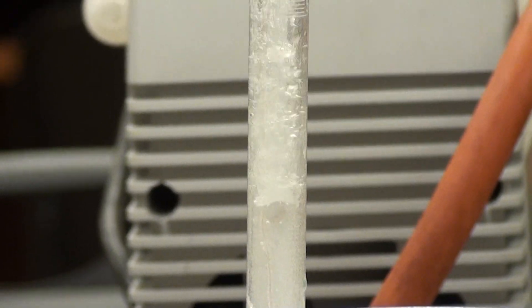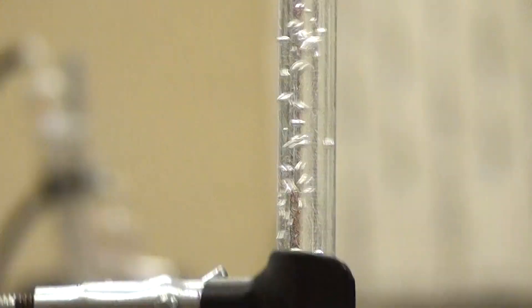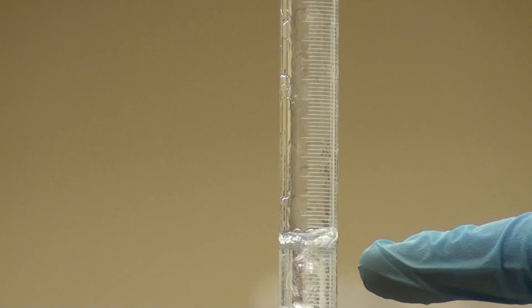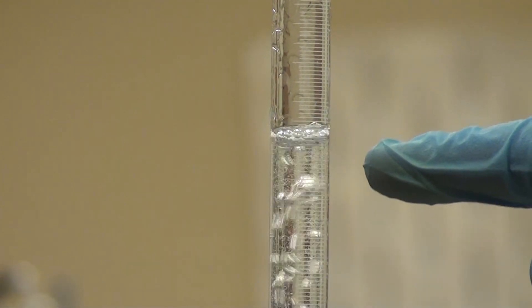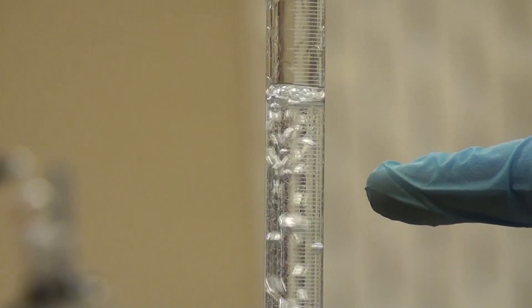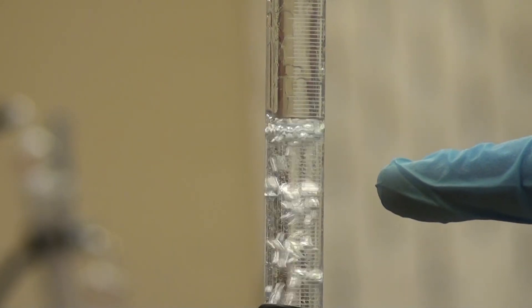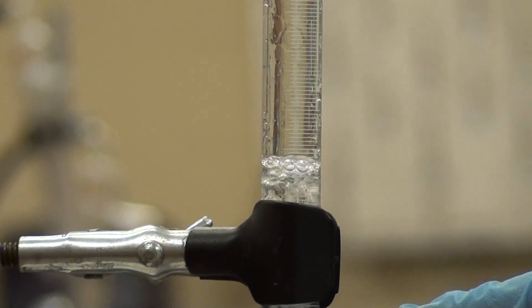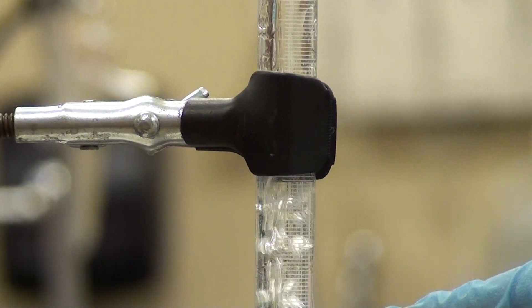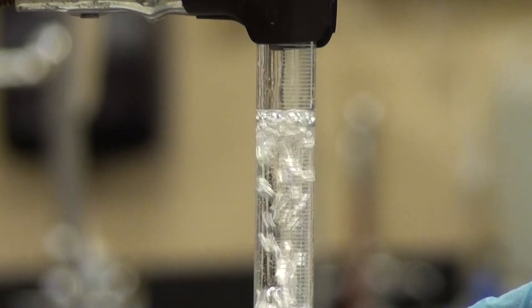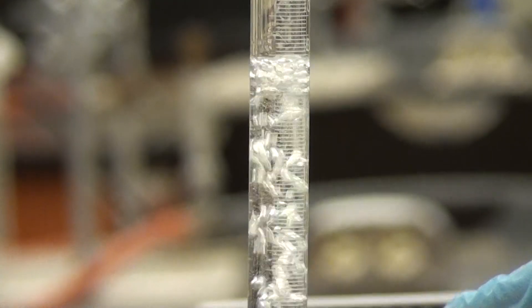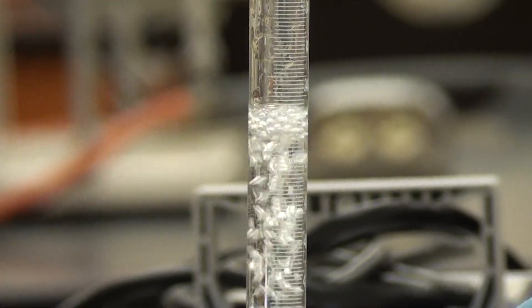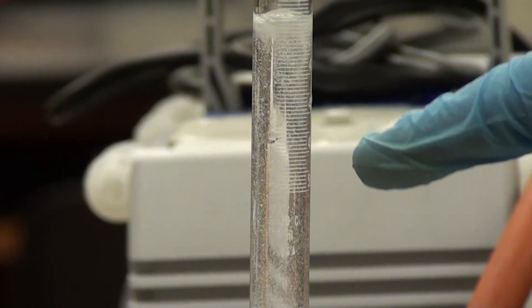Would you move up here? As you can see the hydrogen is forming much more quickly now. And you can see as I followed my finger down here.